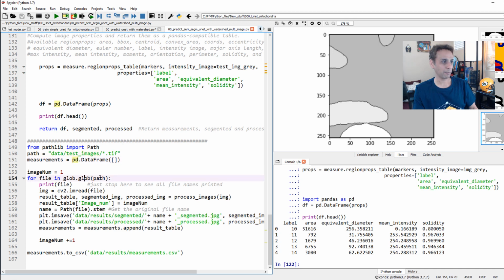For each file in that path, go ahead and read the image and process the images. Process images is this function, and it returns three things, as you know: results table, segmented image, and processed image. To the results table, which is a pandas data frame, add a column called image number and add the number for that image, so image number 1, image number 2. Of course, you can also add the image name if you want. You can also do all kinds of fancy stuff and save images into segmented and processed subfolders with the original image name plus underscore segmented or underscore processed. That's it. I'll share this, but let's go ahead and run it.